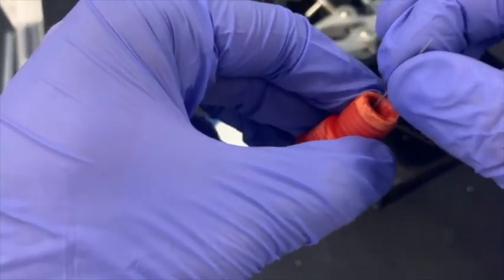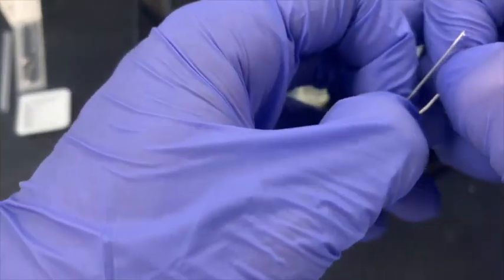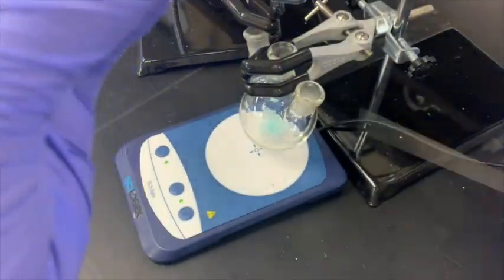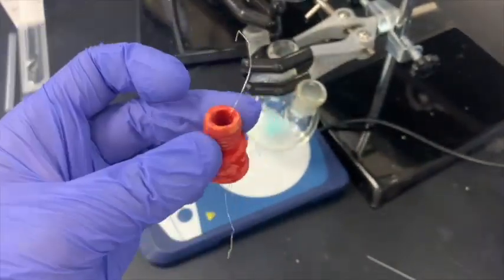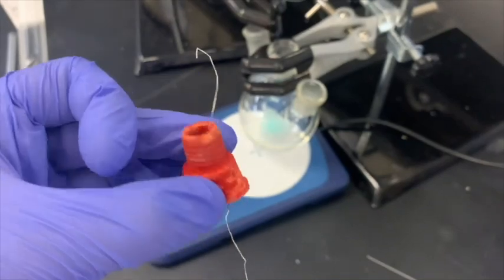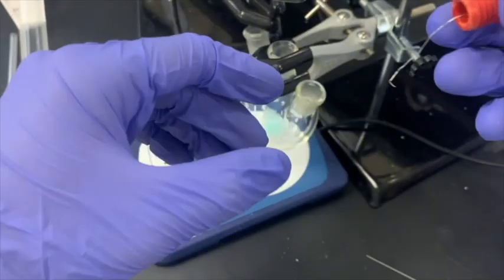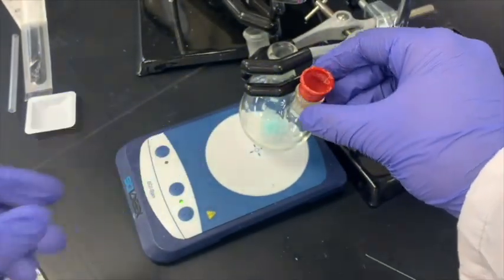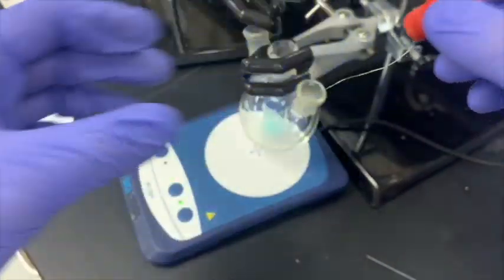This is in place. We can pull the platinum wire out of the tip of the needle and remove the tip of the needle for now. We will need it later, so please keep it nearby. In this case, the platinum wire is not far enough in the septum to actually reach the bottom of the solution. To remedy this, we should take out the septum and pull the platinum wire a little bit further down.